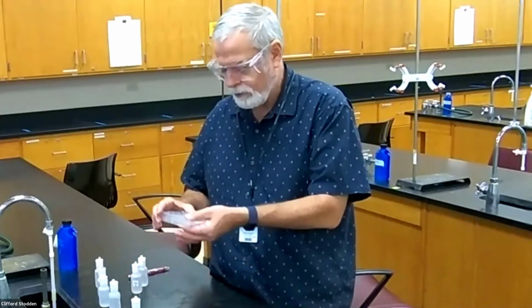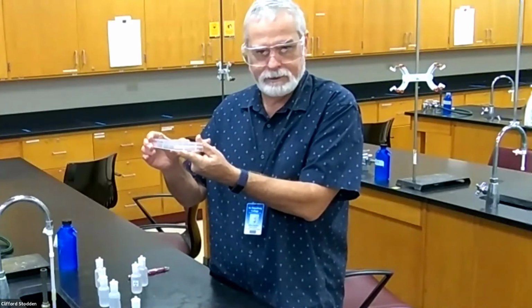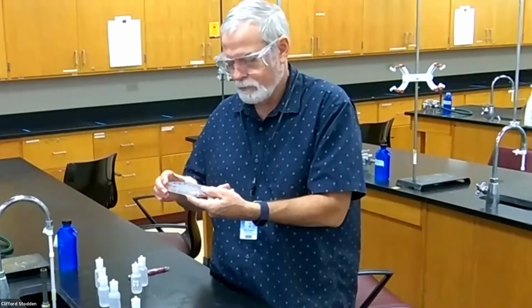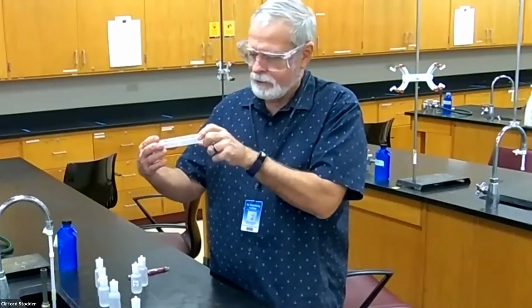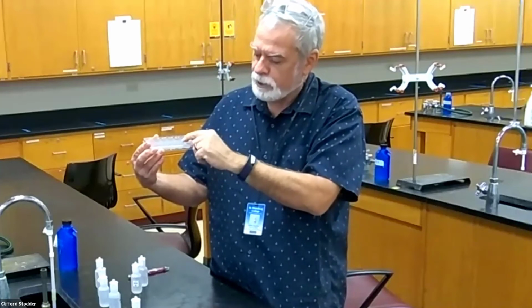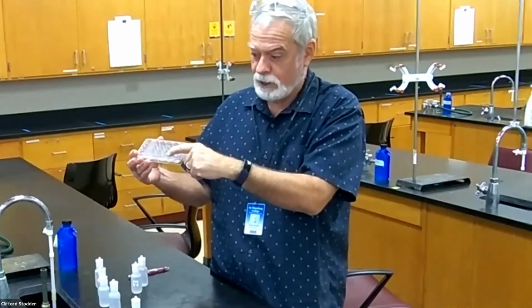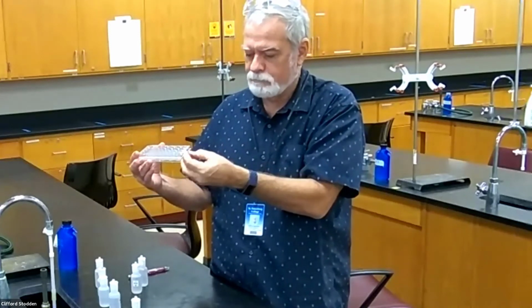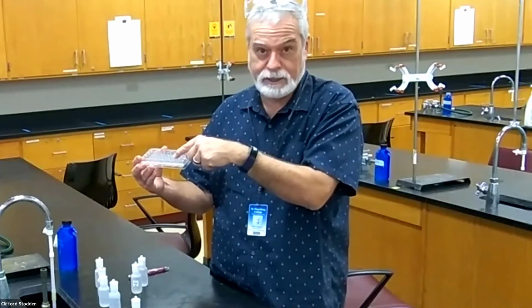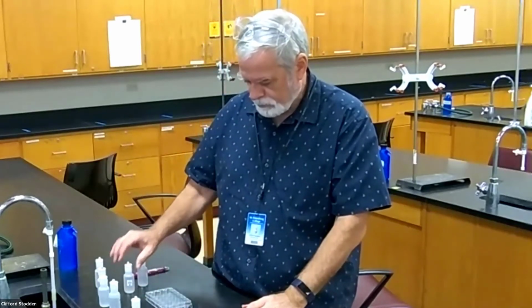Also, if you put your finger on the bottom of the well plate, I can tell that it's a little bit warm, because that is a neutralization reaction. I should have done that right away. It would have been more noticeable. And another thing you can look at, and your book mentions this, I can also see that there's a little condensation around the well plate as well, because it's releasing a little bit of heat, some of the water vaporizes, and it condenses on the sides of the well plate. So that also shows that there's some heat being released.